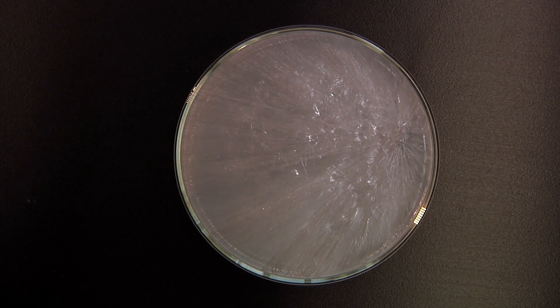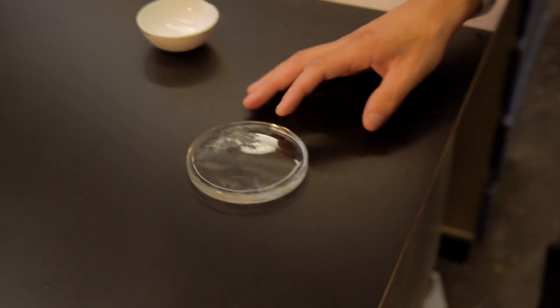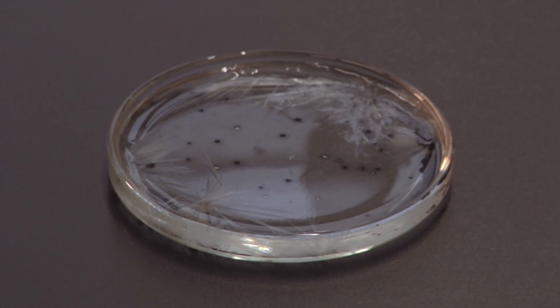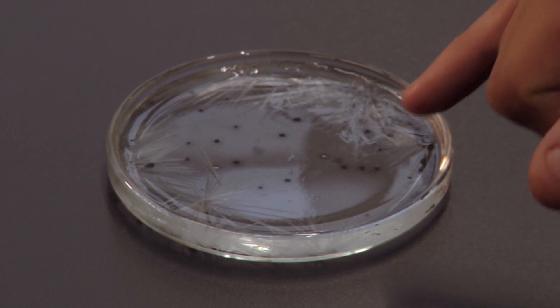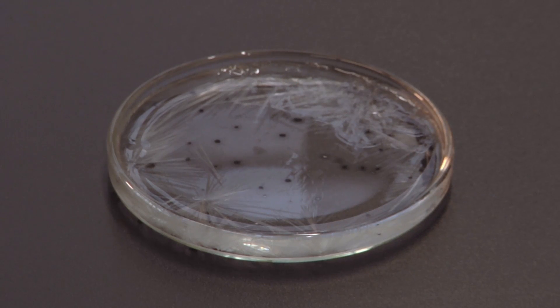That has mystified me quite a lot. Given that I seeded the crystallization by dropping a crystal in, why didn't all the crystals that were already in there — which were sodium acetate crystals — why hadn't they seeded the crystallization process? I don't know the answer to that question; if you think you can explain it, please do so below. This one is going, but extremely slowly because it's still quite warm — you can see these crystals spreading incredibly slowly like filaments through the liquid.